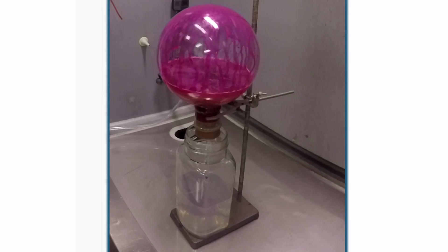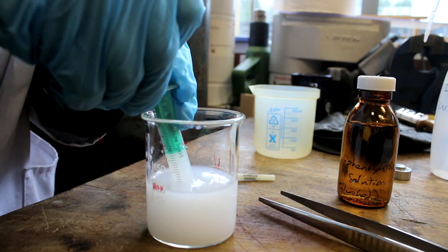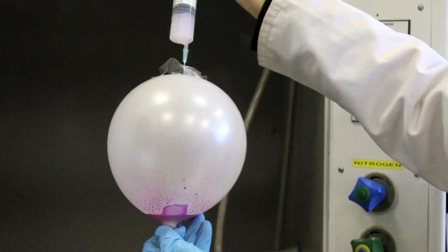I'm really excited. We've got two beautiful demonstrations to show you. One's a real classic, the ammonia fountain. The other one is a completely new one we've invented ourselves, called Neil's Balloon.